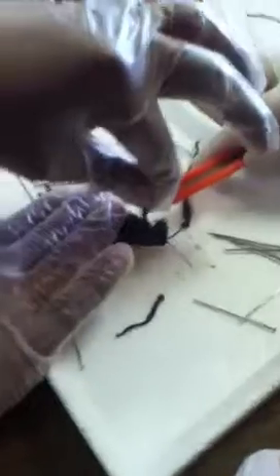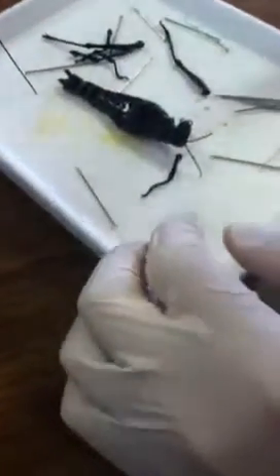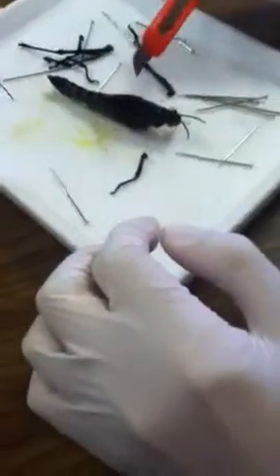Dude, you're shaking. Are you alright? No, I'm just laughing. Don't cut off his head. I would throw this at you for sure. And then you have to get the wings — you have to cut off the whole wing. Okay.